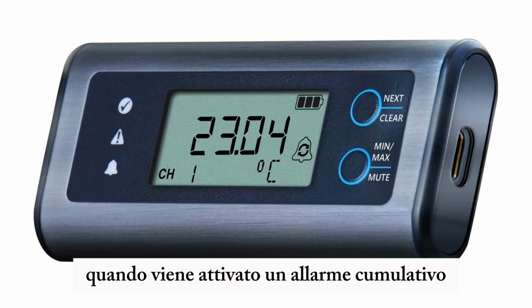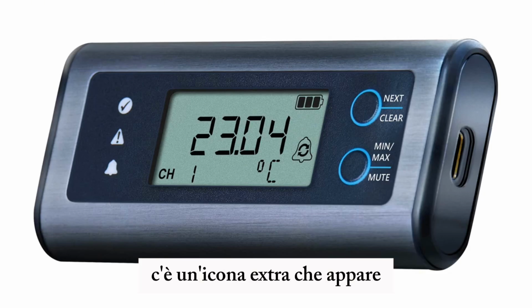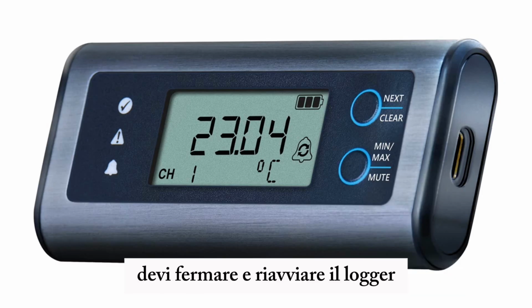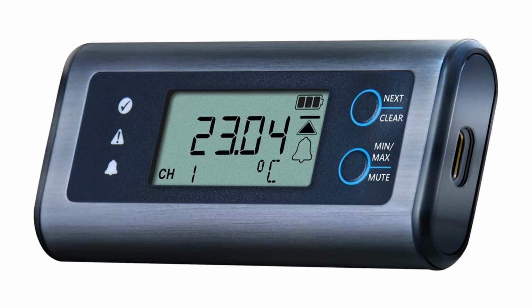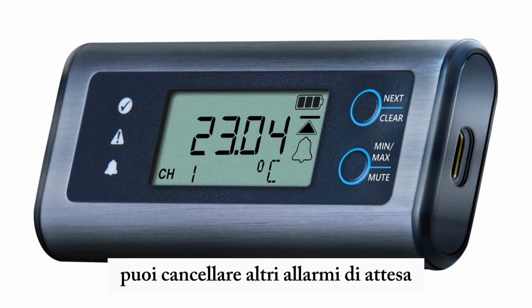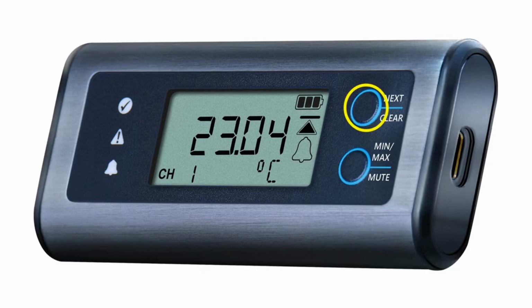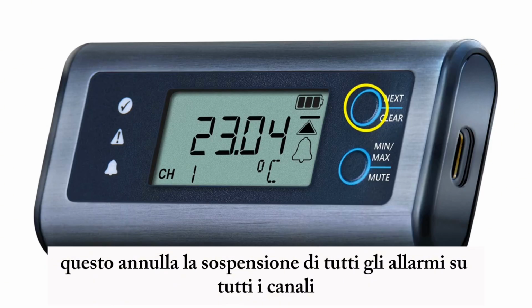When a cumulative alarm is activated, there's an extra icon that appears inside the alarm icon. To clear the count of a cumulative alarm, you have to stop and restart the logger. You can clear other held alarms by going to the current readings on any channel and doing a long press of the top button. This cancels the hold on all alarms on all channels.